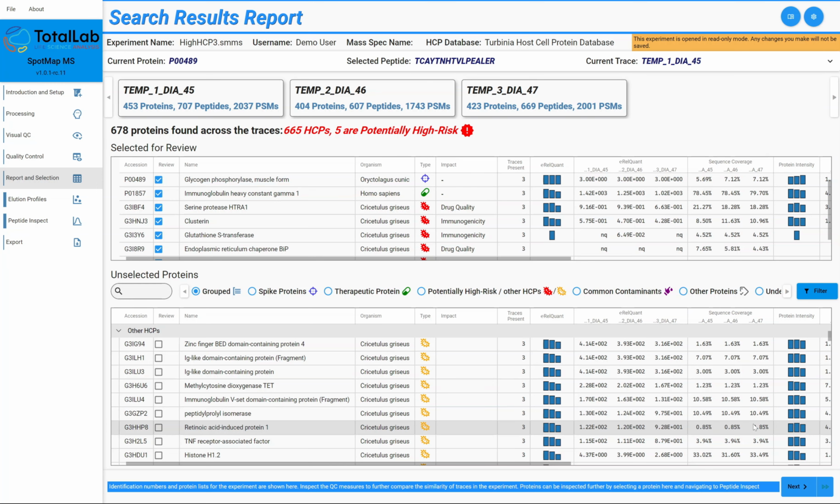Hello everyone. So today I'm going to be guiding you through a few new features we've added into the latest version of SpotMap MS, our automated LC-MS based host cell protein analysis software, based directly on feedback from industry and from our customers and partners and generally the people that we interact with that are doing this on a day-to-day basis. And if you're watching this, you probably are someone that's going to be doing this on a day-to-day basis.